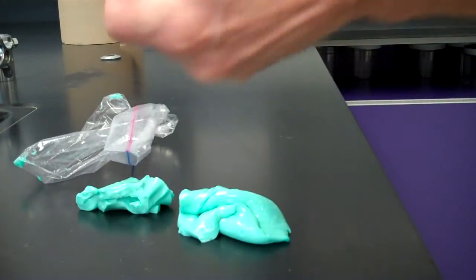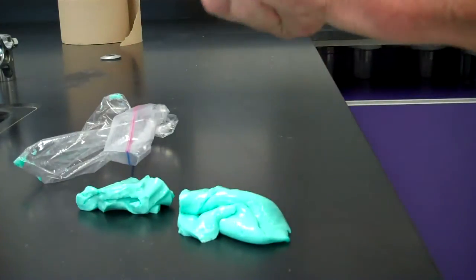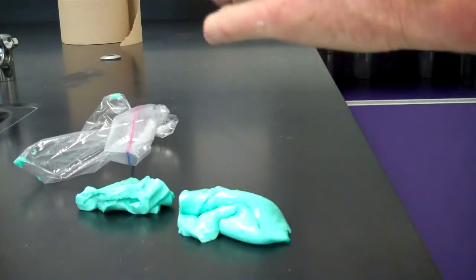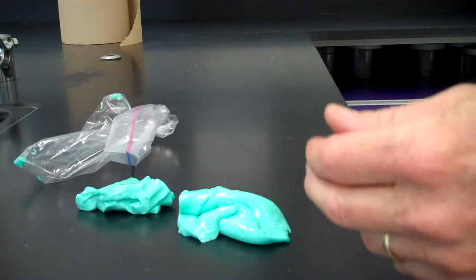When it says roll it into a ball, that'll take a little bit of work, but you might want to just squeeze it into a ball, and you drop it from a height of a foot and watch what happens.